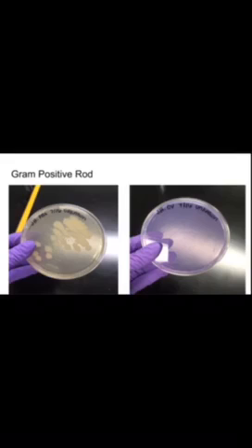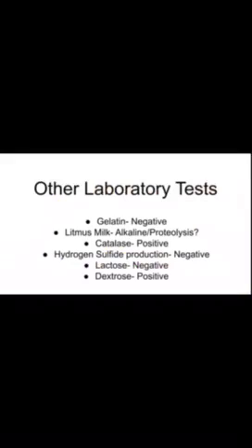I knew the acid-fast procedure would be the definitive test, but I wanted to be sure and chose to perform other tests to distinguish between these 3 bacteria. During the next several days, I inoculated my unknown alongside most of my other tests performed in lab. My gelatin returned a negative result, which ruled out Bacillus cereus, but my litmus milk appeared to have peptonization, which put it right back on the table.